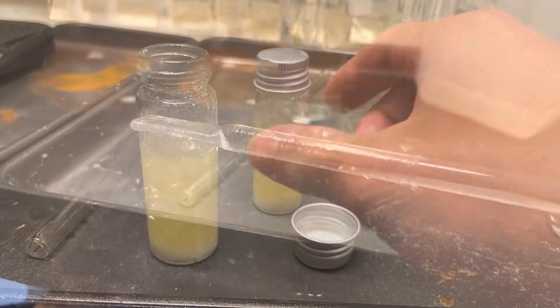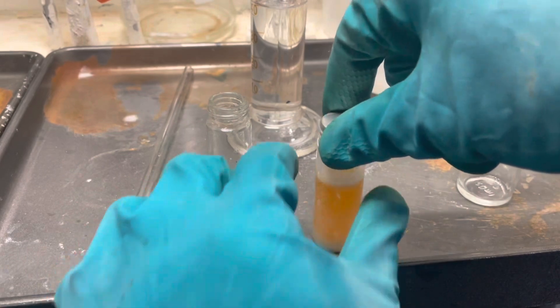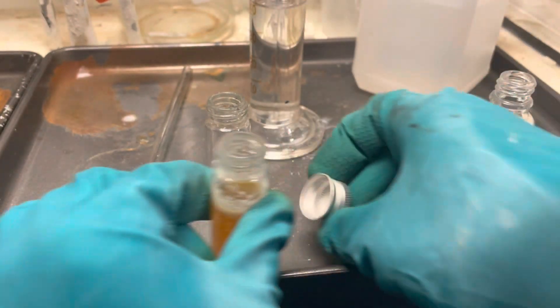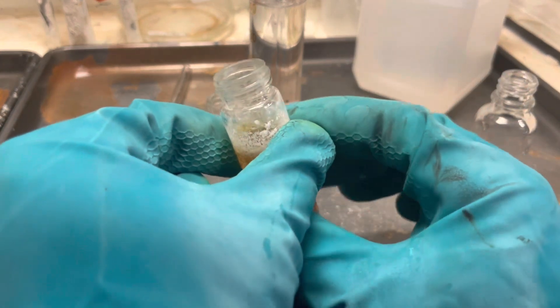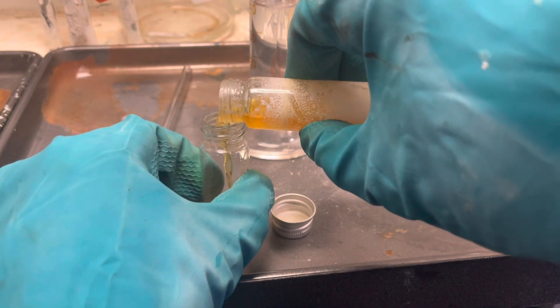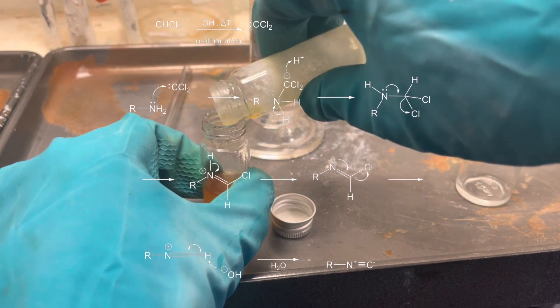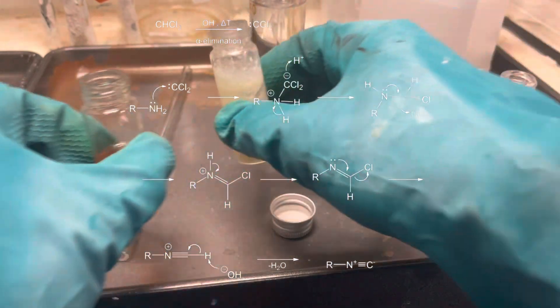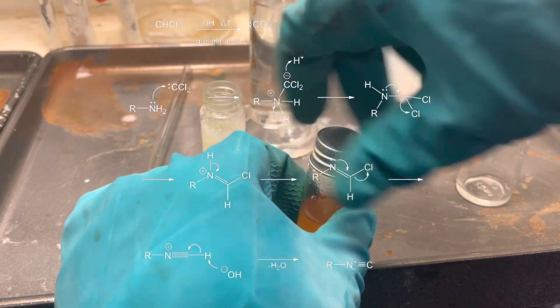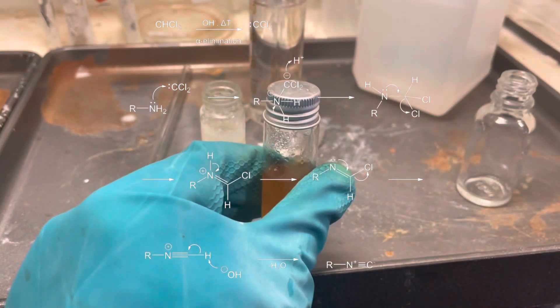You can see here some sodium chloride already precipitating, but we're gonna heat it up anyways. The best description of the smell would be burning cooking oil — because of the acrolein — and some seaweed or kelp. After a few minutes of heating, here's our final solution. We're gonna decant it off, and here you can see the reaction mechanism. Just replace the alkyl R with a phenyl group, and that'll be the reaction. And then, ta-da, we get our phenyl isonitrile.